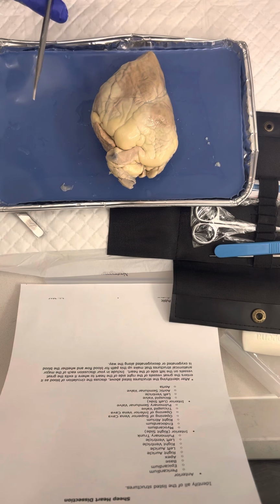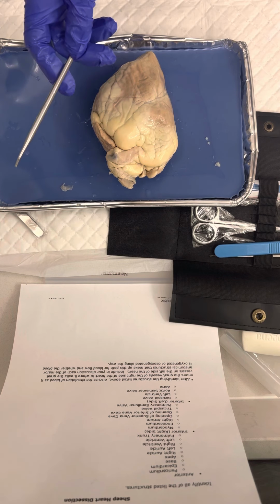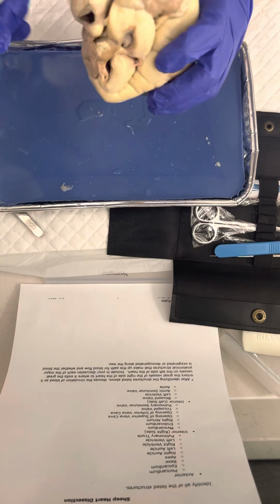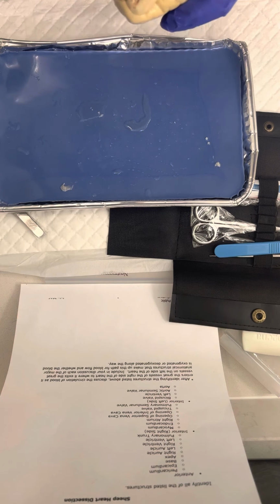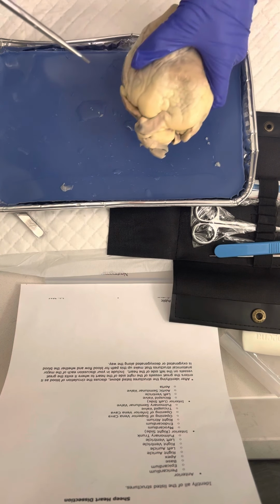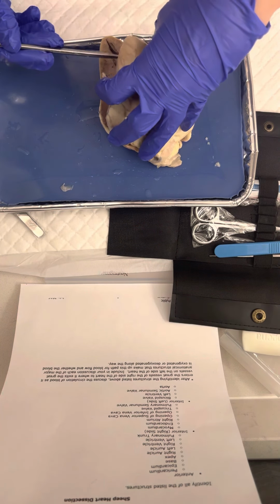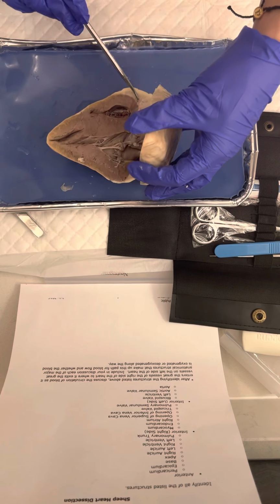After I did the structures, now the circulation of blood. Blood will enter the heart through two veins in the body, the inferior and superior vena cava openings, emptying deoxygenated blood from the body into the right atrium, which would be right here.